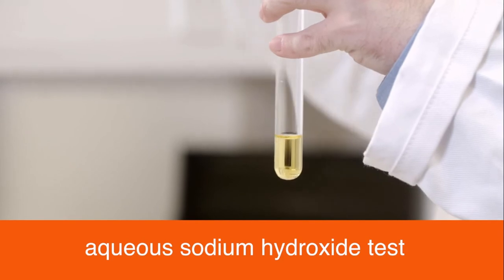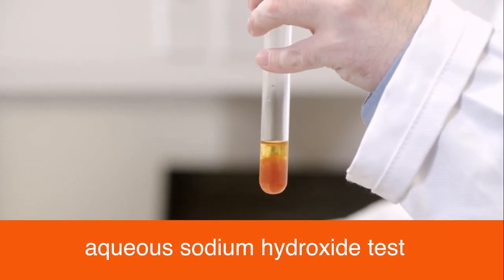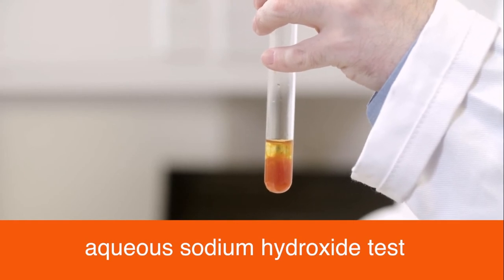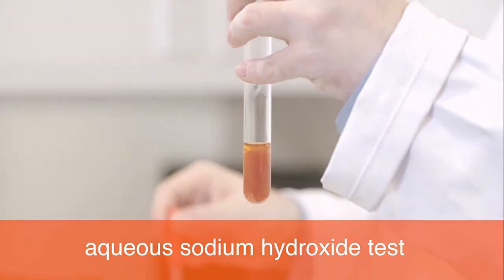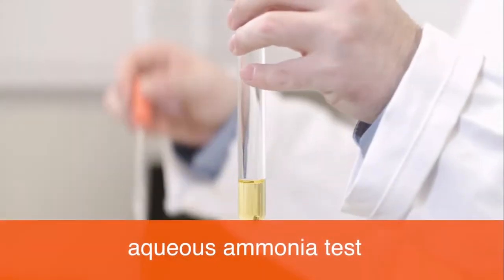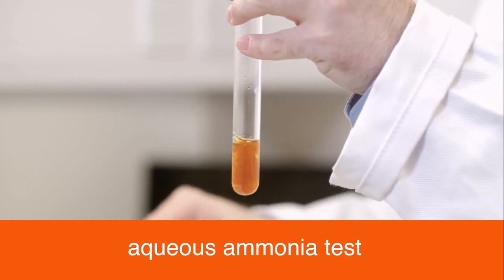A red-brown precipitate, which is insoluble in excess when aqueous sodium hydroxide is added, indicates the presence of iron 3. The same result is observed with aqueous ammonia.